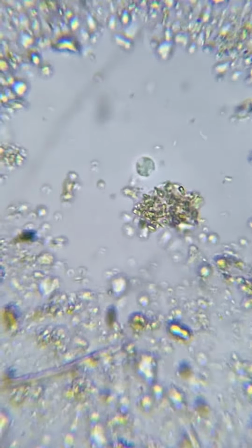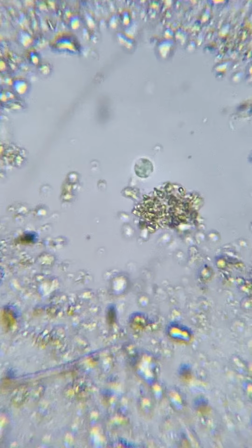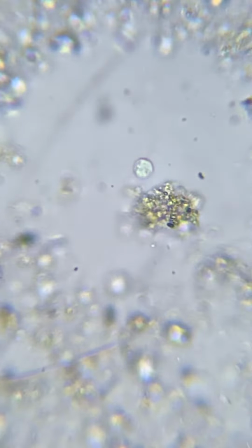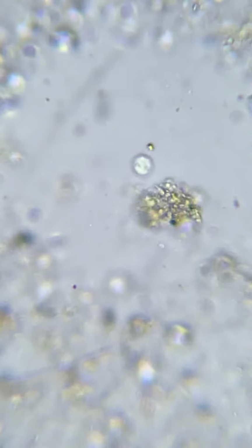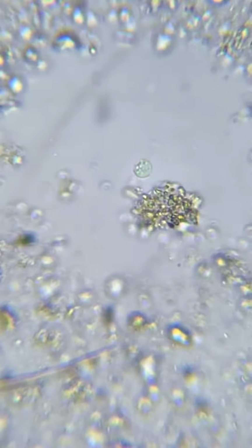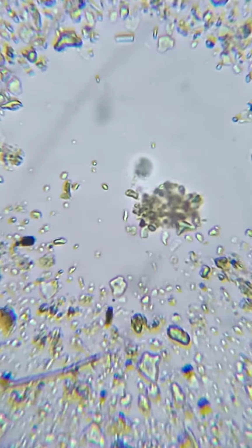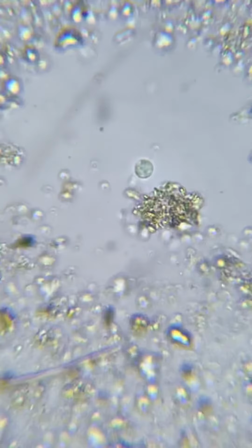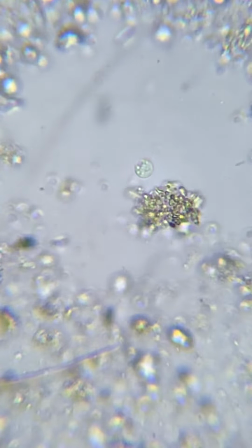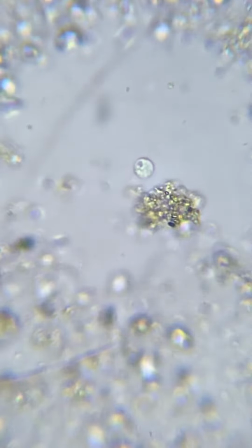And I'm all the way up on my phone as well. Now, once I stop this and print it, or save it, I will be able to enlarge it yet again under photo editing. So let's just go real slow, up and down, and see if we can get the cilia moving.